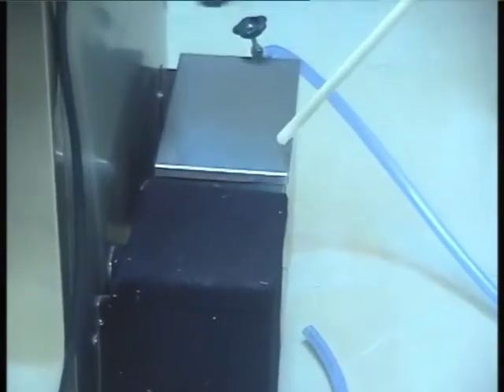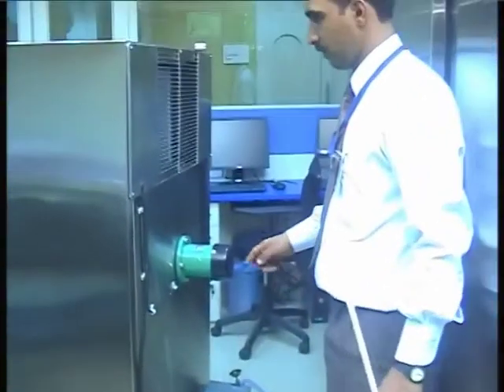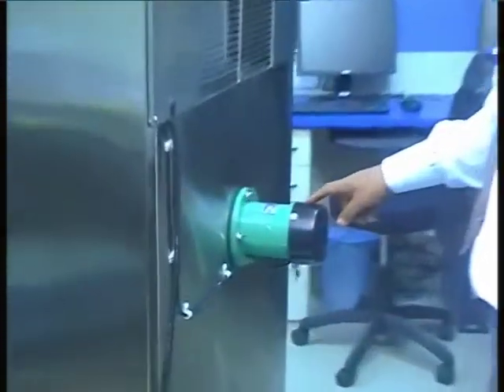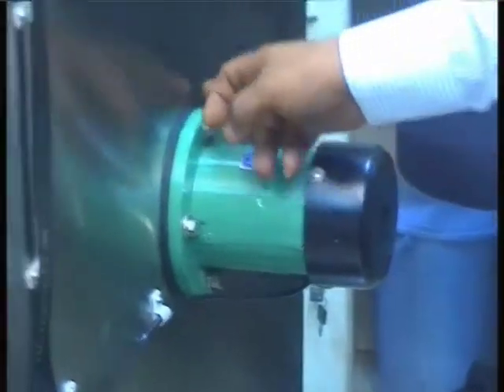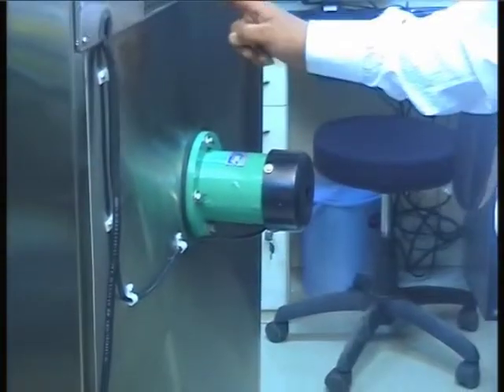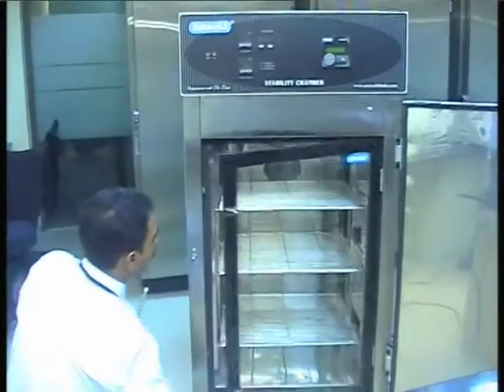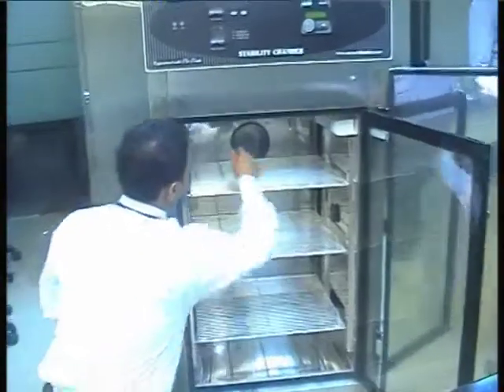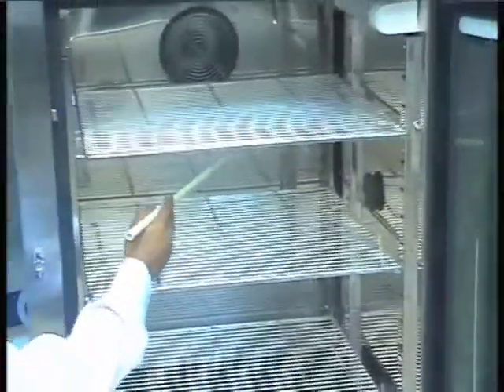The steam generator generates steam which is fed to the chamber for achieving the desired level of humidity. The air circulation chamber motor is mounted on the rear side with its shaft extended inside the chamber and is fitted with an impeller. The impeller on rotation blows and circulates air inside the chamber.